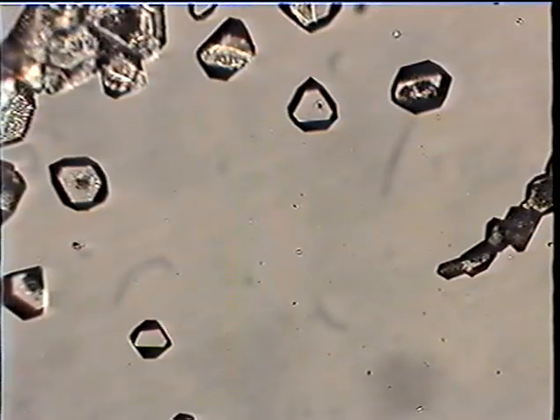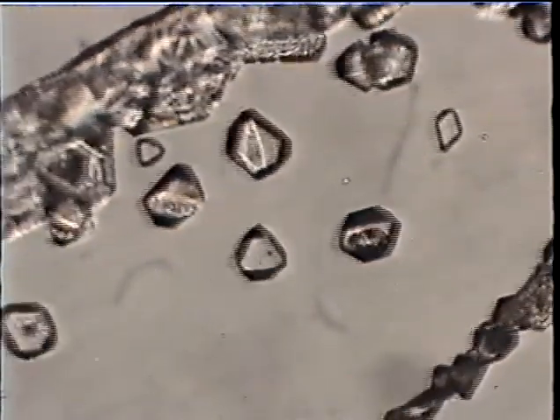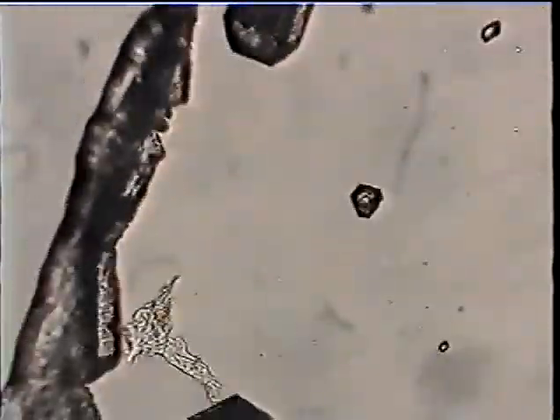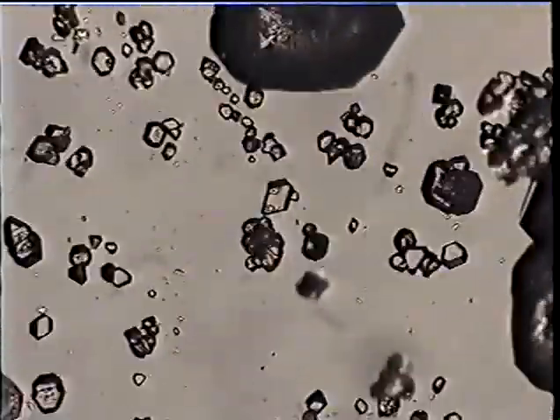We're now recrystallizing lead nitrate from water. Again, a tiny drop. The edge of the drop is along the left. We're going down inside the droplet of water, where we have the crystals that have crystallized out as it evaporated. The bigger crystals are ones that I put in and crushed up a little bit in order to saturate the droplet of water.